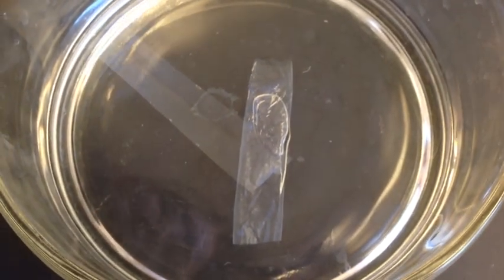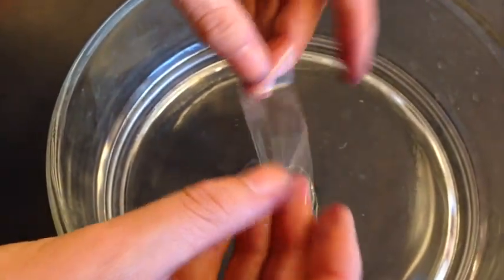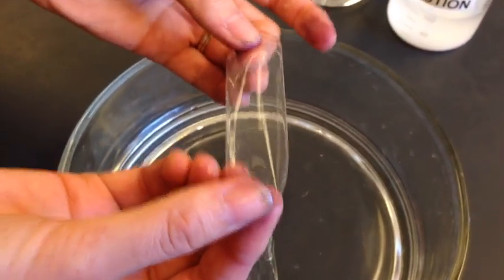To start your dialysis bag experiment, grab some dialysis tubing that's been soaking in water. These can be difficult to open and are best when very wet.